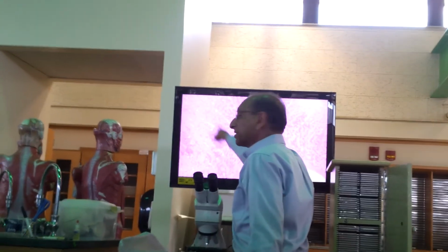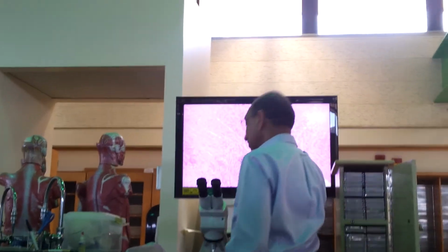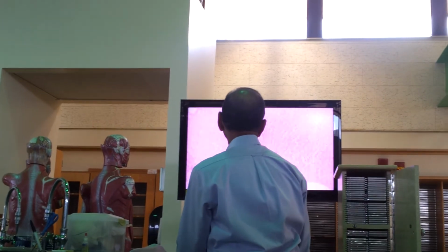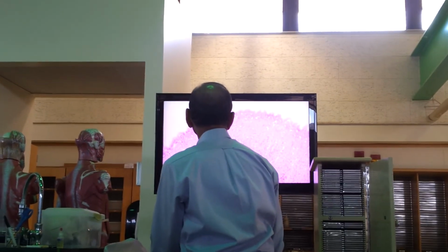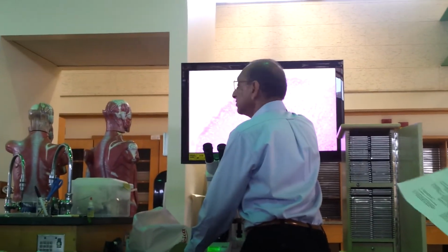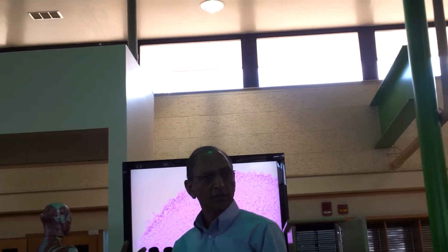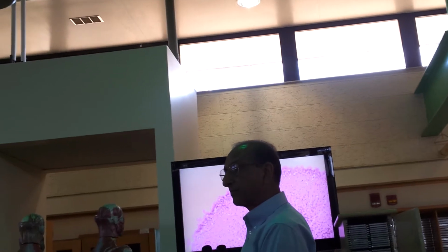All these are gastric glands. Right? They go as tubes, long. Sometimes you will see them long, sometimes you will see circles, depending on the way the section is going through. So they're all gastric glands, and on the surface, you see, for example, gastric epithelium. And this epithelium is again simple columnar, right? It's easy, right? Easy. And what is the next slide?